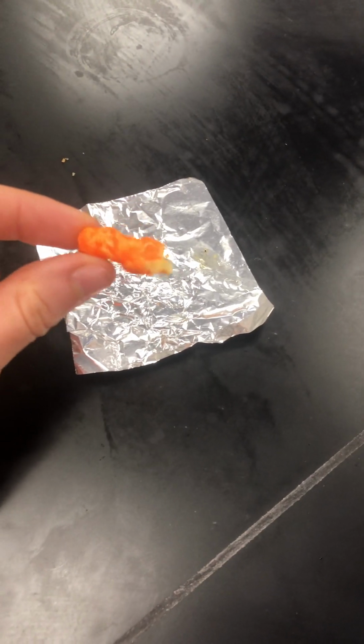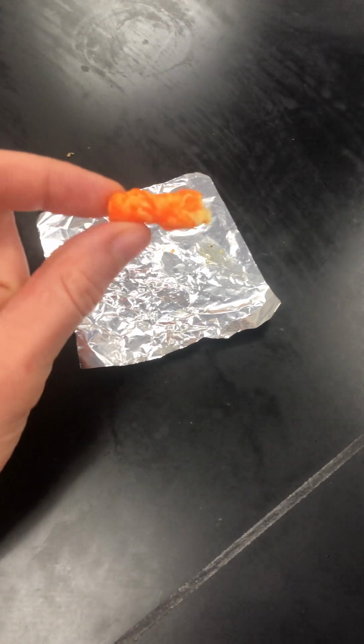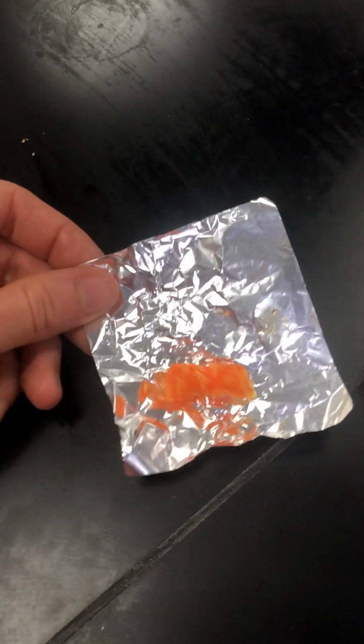So remember, wildfires require the fuel or the fire triangle. That is fuel and oxygen with energy is what keeps our wildfires burning. So if we could relate this to that, our Cheeto in this case is the fuel. And remember that there's chemical potential energy stored in the bonds of this Cheeto, okay? And we have oxygen that's going to react within the air. And essentially, we're going to add energy to the system by lighting the Cheeto on fire.